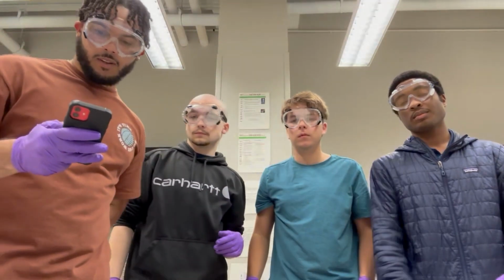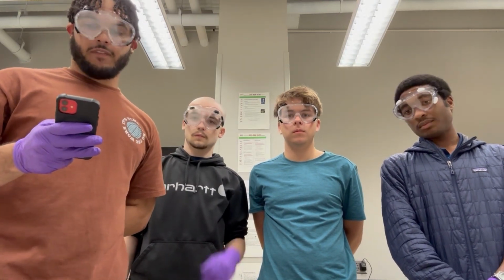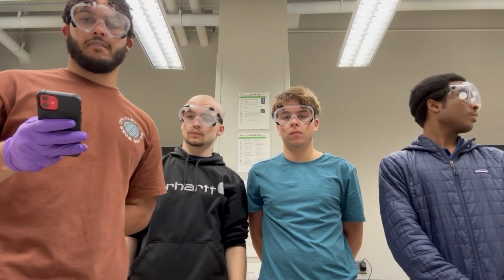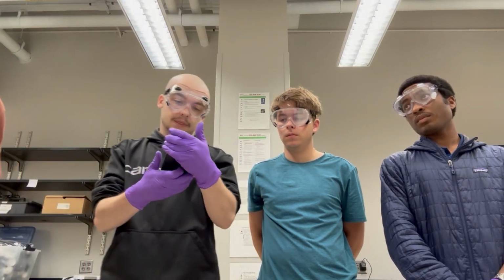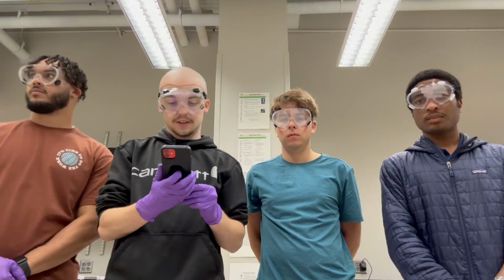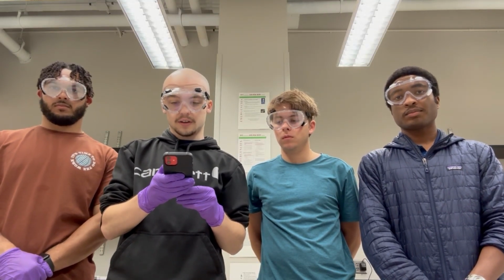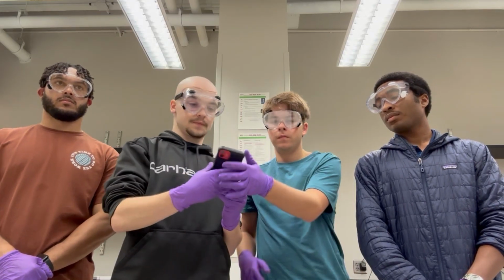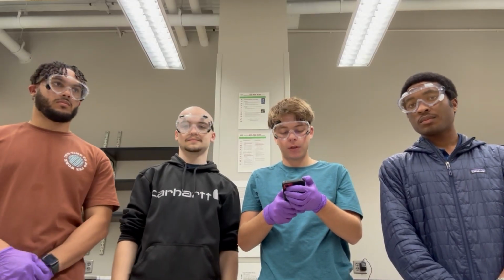Alright, so the Beer-Lambert law is a fundamental relationship in analytical chemistry, particularly in UV-visible spectroscopy, which states that the concentration of a chemical substance in a solution is directly proportional to the amount of light absorbed by that solution. The equation involves 4 variables, each with a specific meaning. A is absorbance, epsilon is molar absorptivity, b is path length, and c is concentration. And then the equation itself is A equals epsilon times b times c.